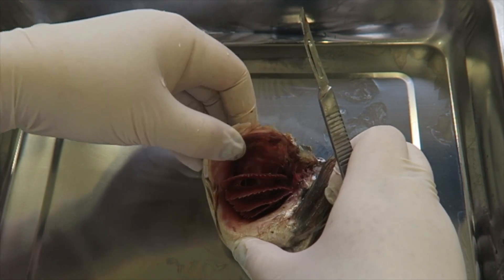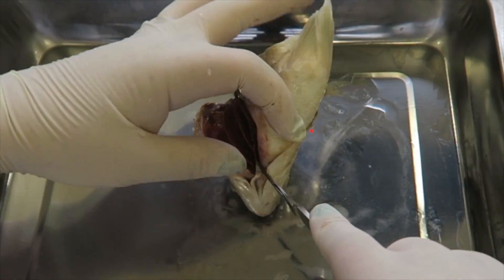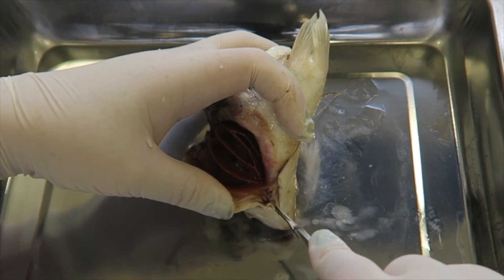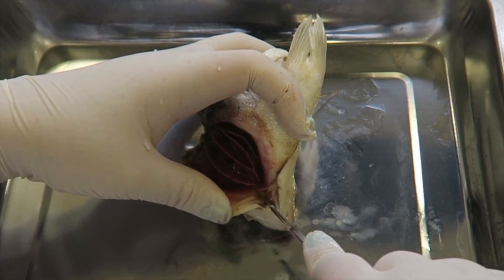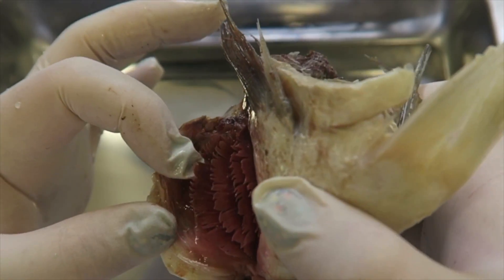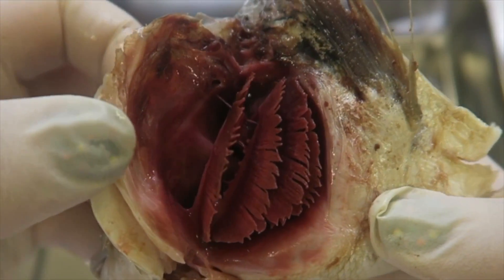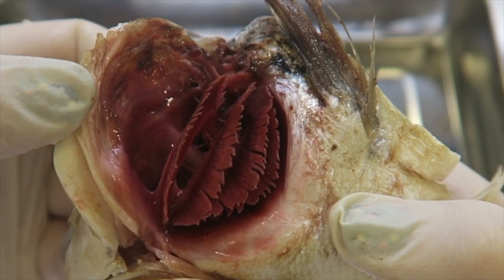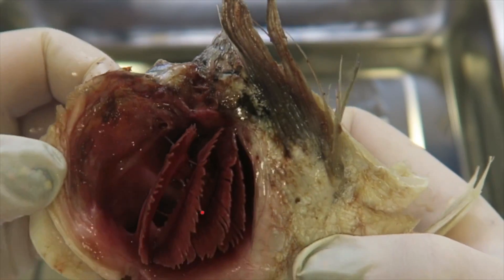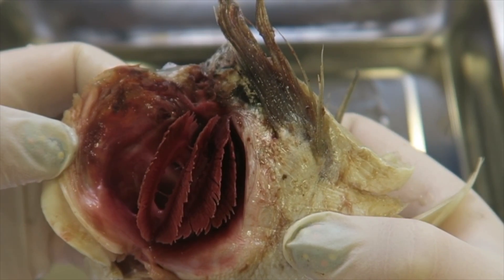You can see there are a large number of gills in here. We can start by taking the gill off — you can see the colour shows there's a high concentration of blood vessels. These are all attached at each end with a strong firm structure, the gill arch.